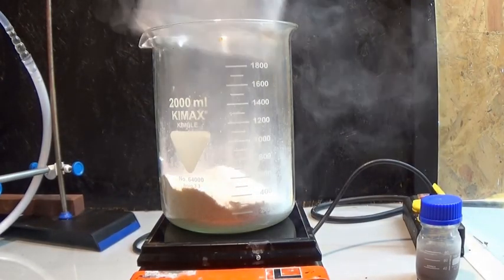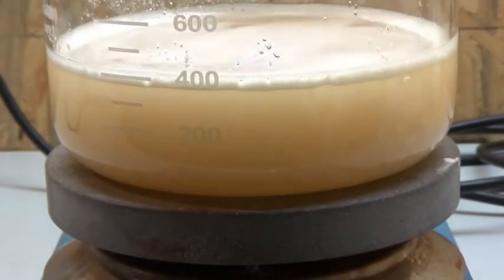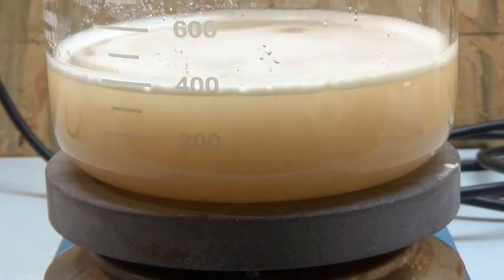This was then brought into hot solution. Next up I added the calcium acetate to my 2 liter beaker and also dissolved it in warm water.